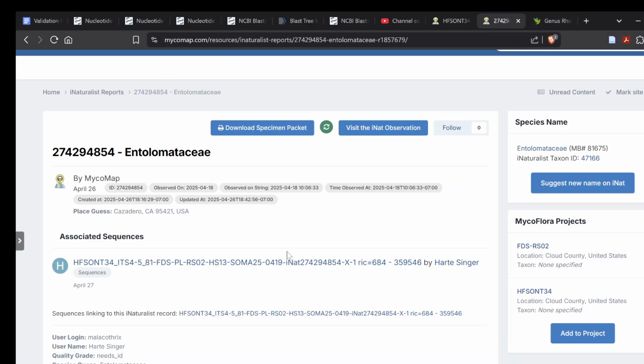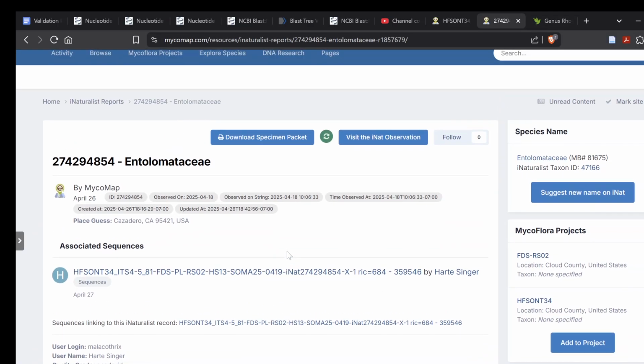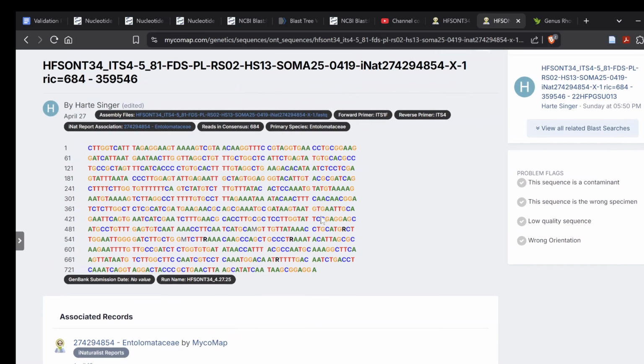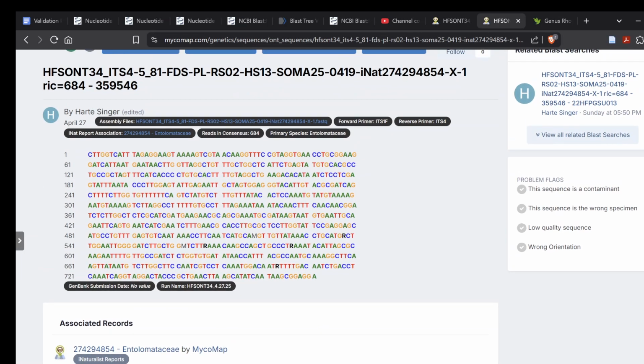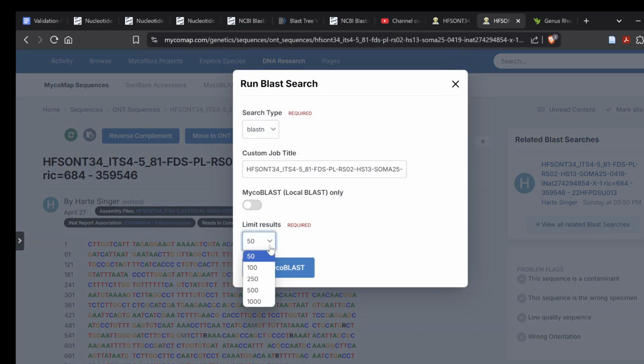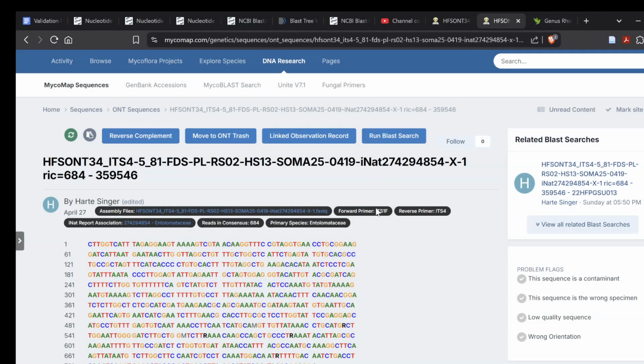You would go to the dashboard. Rather, you'd go to the sequence page here, and you would go to Edit, and you would replace whatever sequence is in there with your consensus, and then you would go ahead and do a new BLAST search. And probably 100. Whenever you're doing really polymorphic sequences, it helps to have more results because it'll probably match against a wider berth of things.